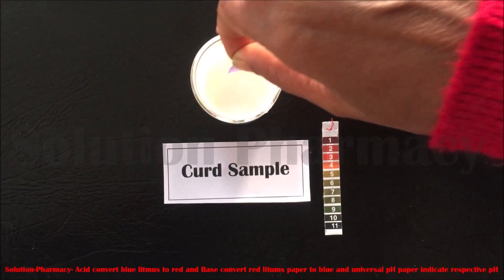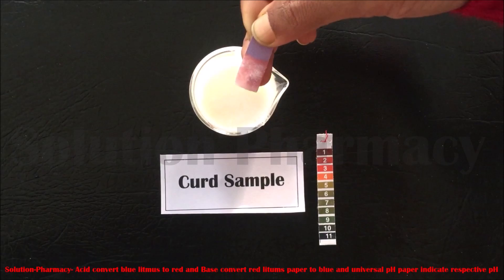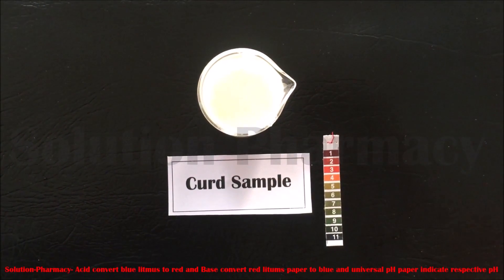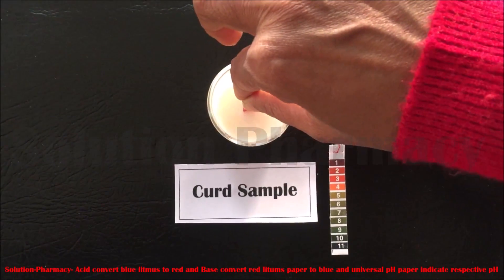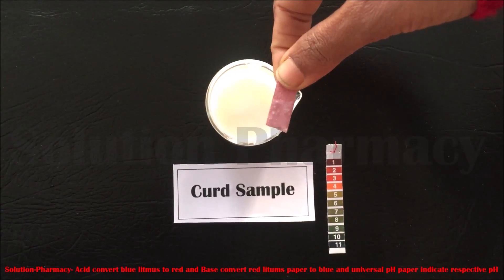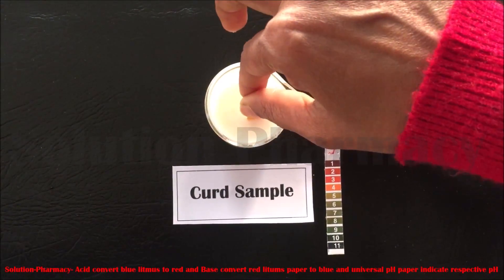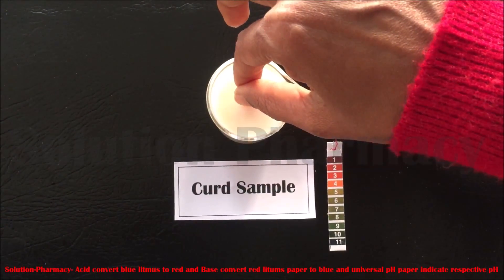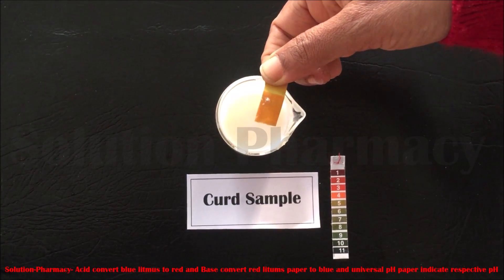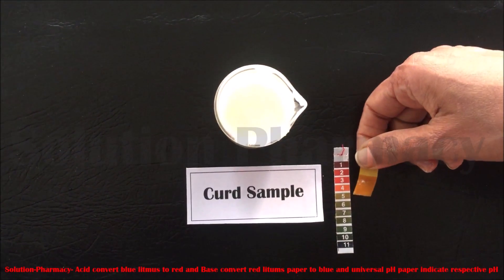The next sample is curd. Dip the blue litmus paper into it — blue litmus converts to red, which means curd is acidic in nature. Next, dip the red litmus paper into the curd sample. There is no color change in the red litmus paper, which means curd is not basic in nature. Now dip a strip of universal pH paper into the curd. The color of the universal pH paper changes to the value 4, so the pH of curd is about 4.